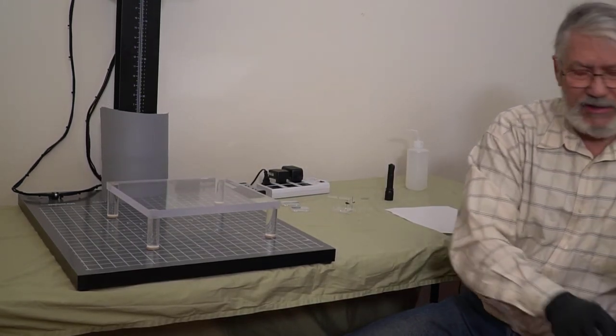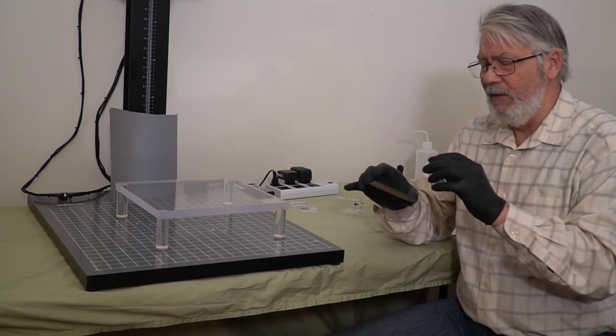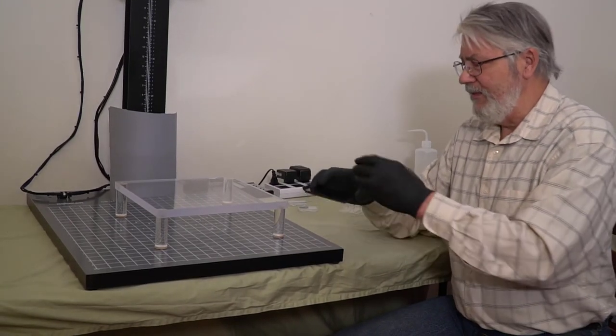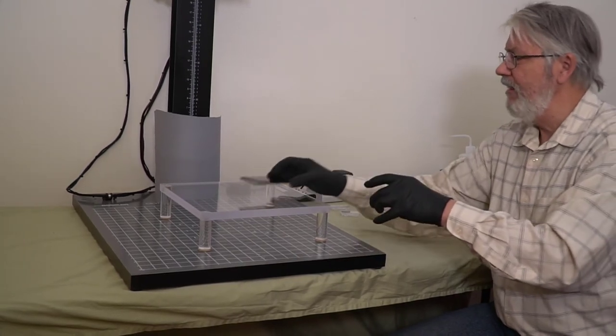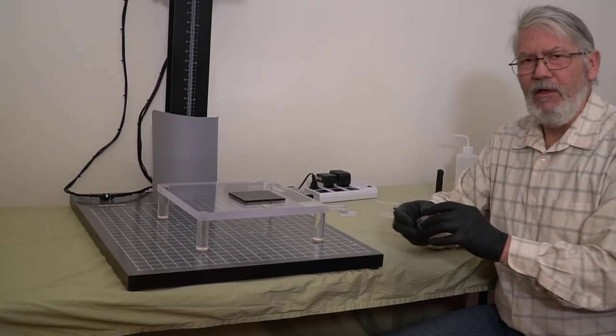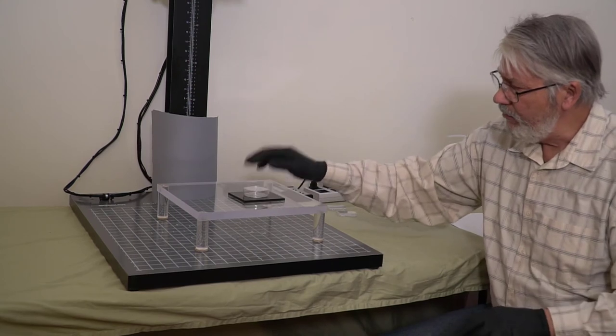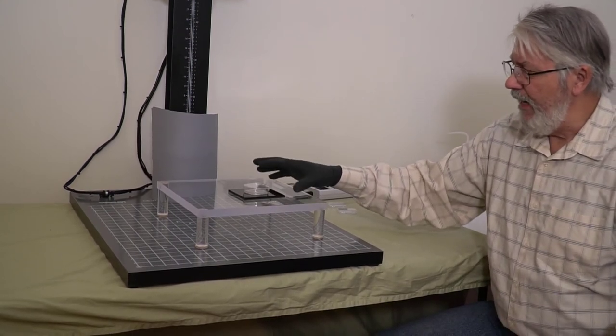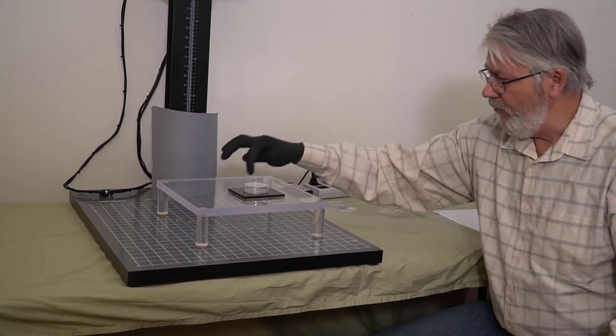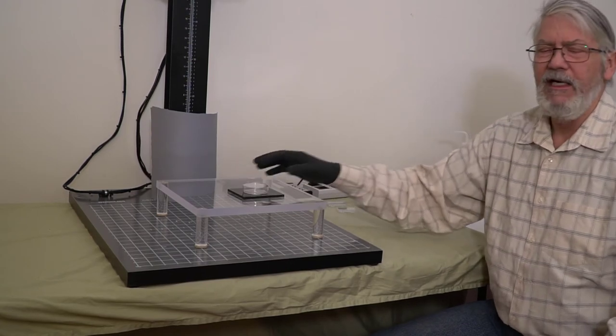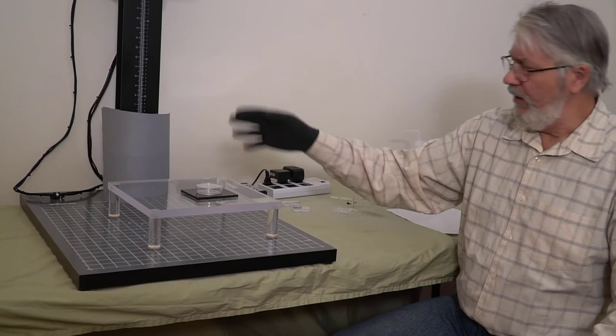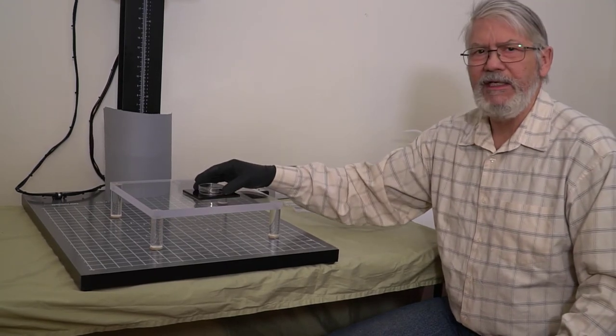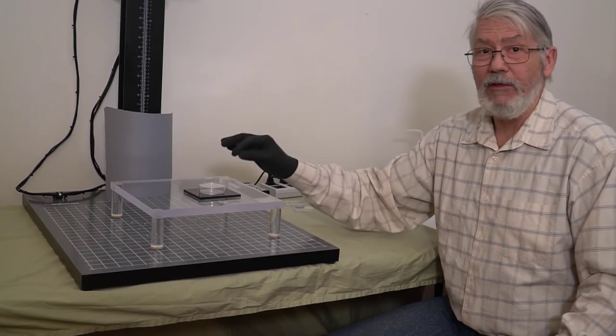Lastly, I'm not going to get too much detail—I'll show you this when I'm shooting in ethanol. There are some techniques to prepare the petri dish to bond to the plexiglass. When we want to shoot in ethanol and have a black background, we're going to use a special plastic back and we're going to bond it by putting ethanol between the petri dish and the plastic. I will go through techniques on how to mount this with KY jelly and different things to make your small stuff stick where it's supposed to.